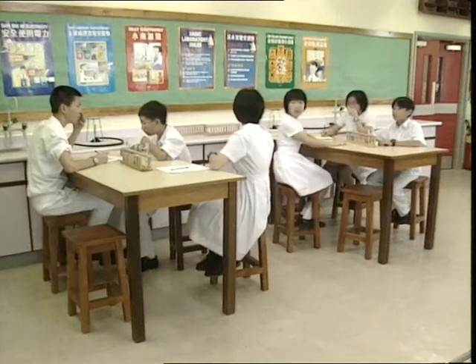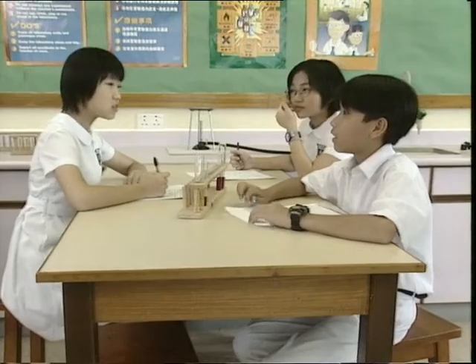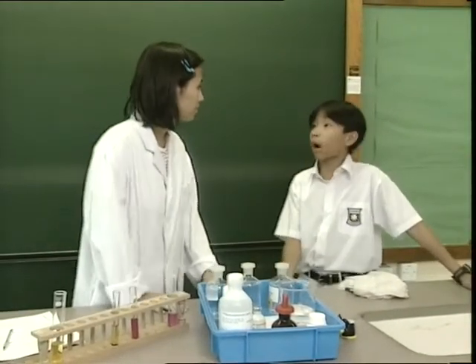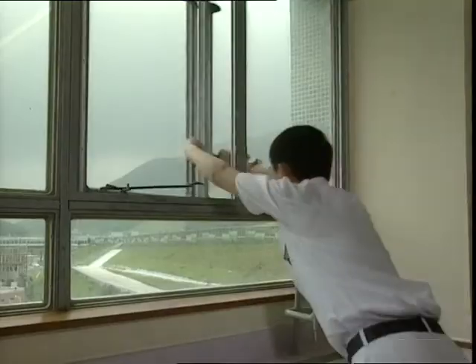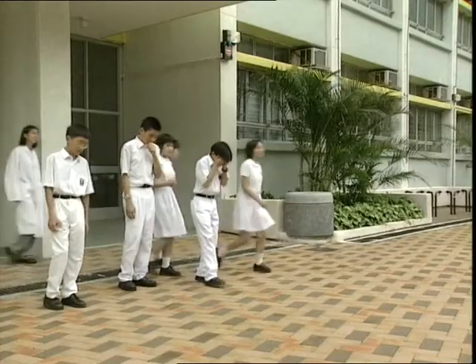If you feel uncomfortable when you have breathed in certain gases, let me inform the teacher. You should report to the teacher immediately. We smell some unknown gas. And open all the windows in the laboratory. Leave the laboratory according to the teacher's instruction and go to an open area.